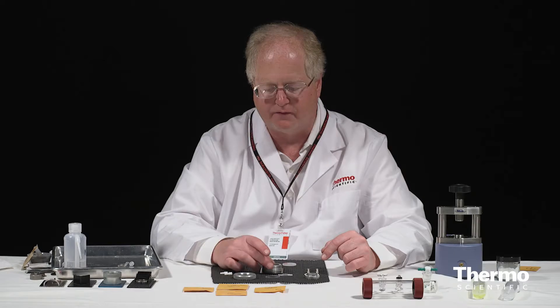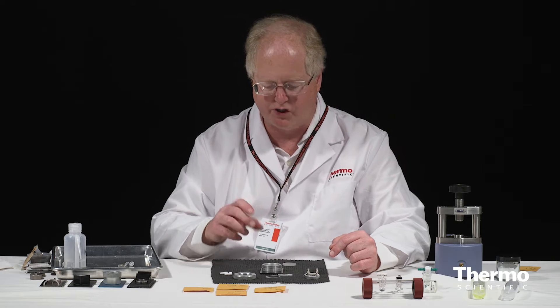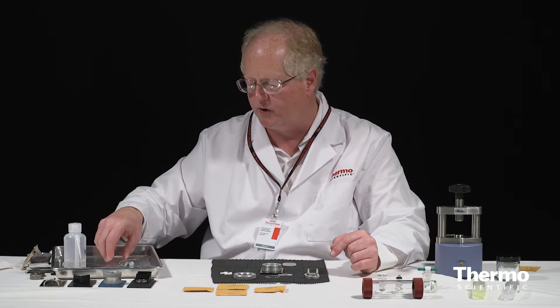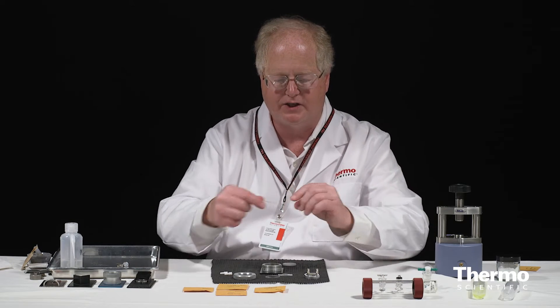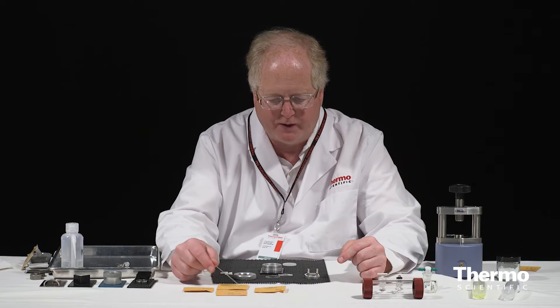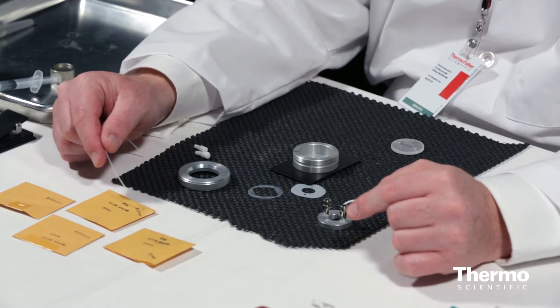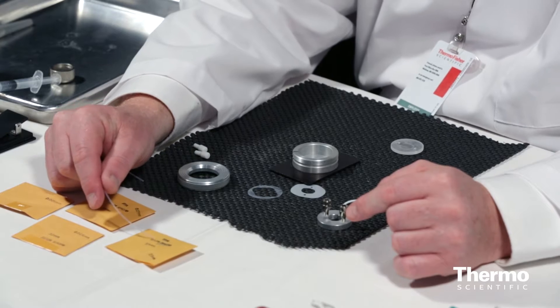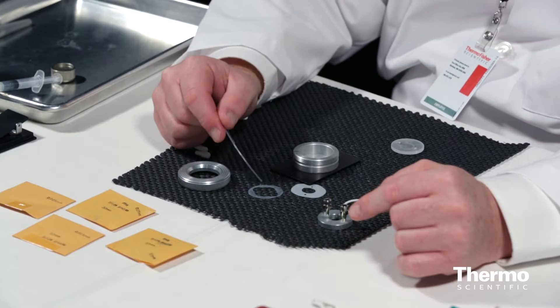I'm going to take my first window and drop it in there. That window is a solid window so the orientation doesn't matter. The next step is the first of the critical steps: insertion of the spacer. You can buy these cells with variable spacers — for instance, here I have a 25-micron spacer, a 500-micron spacer, another 25-micron, and a 15-micron spacer.